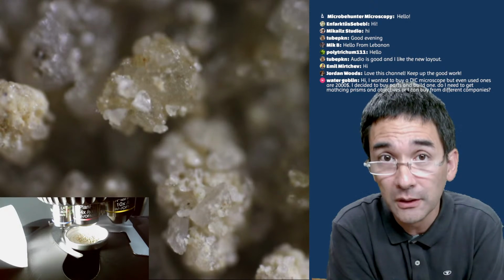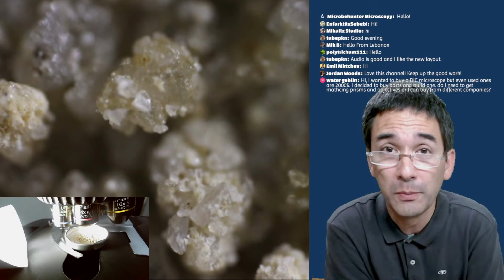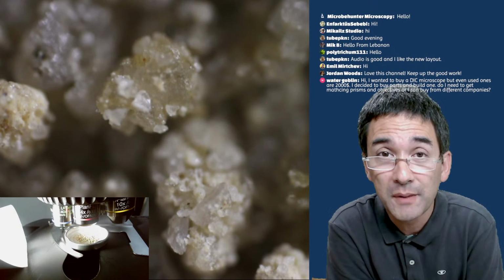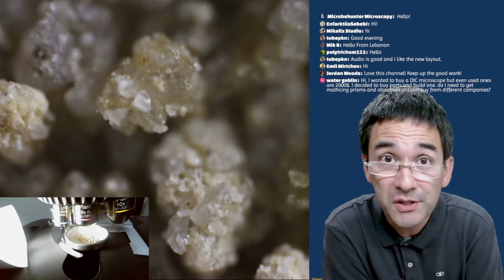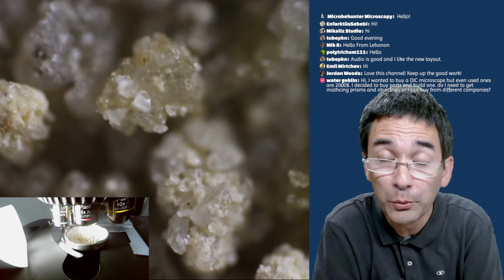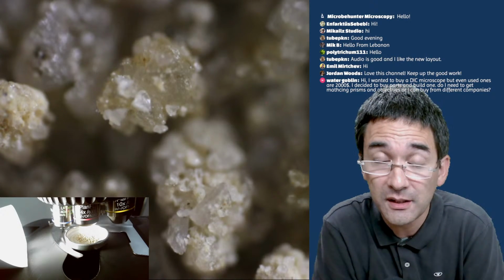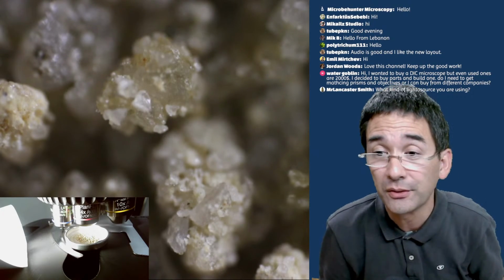But what people have done is they have put together their own DIC microscope using used parts from one system. I've known a person who assembled his own DIC microscopes from parts from Olympus, for example. So you've got to stay with one company, and then go and shop on eBay until you get all of the parts together. Otherwise the parts are not compatible with each other. You might not be able to fit them together.